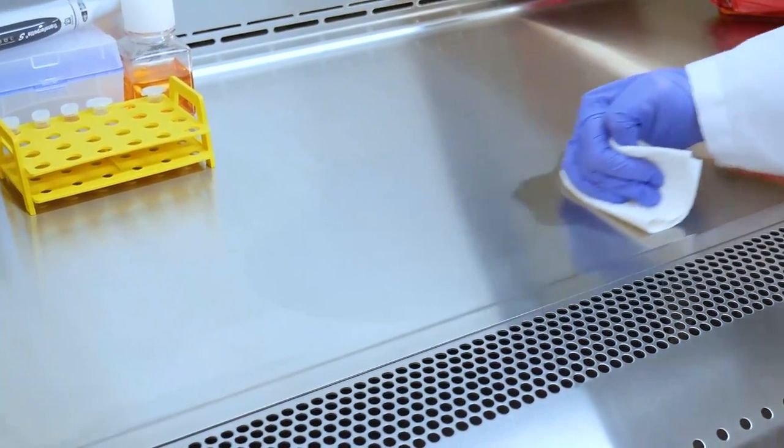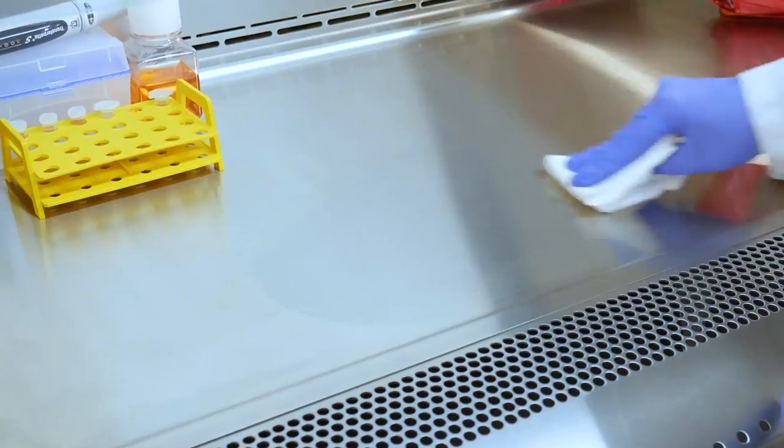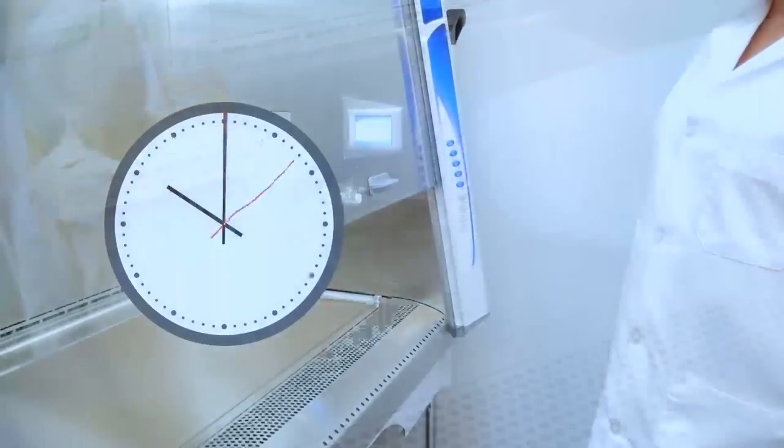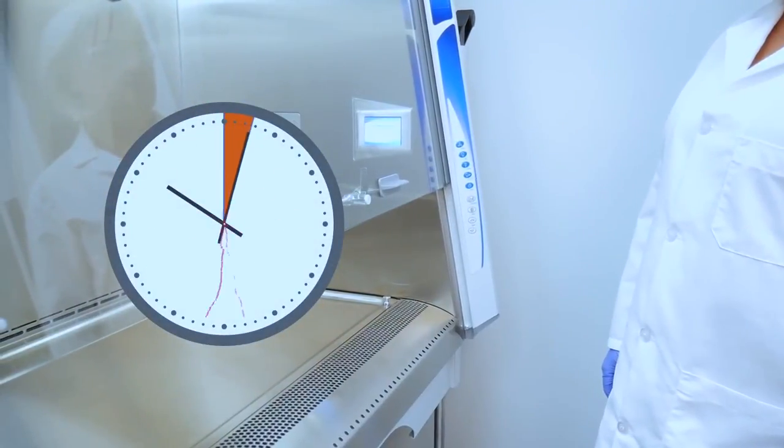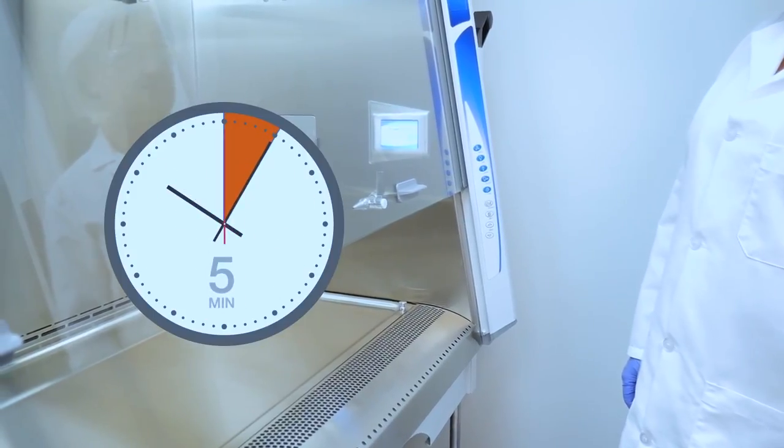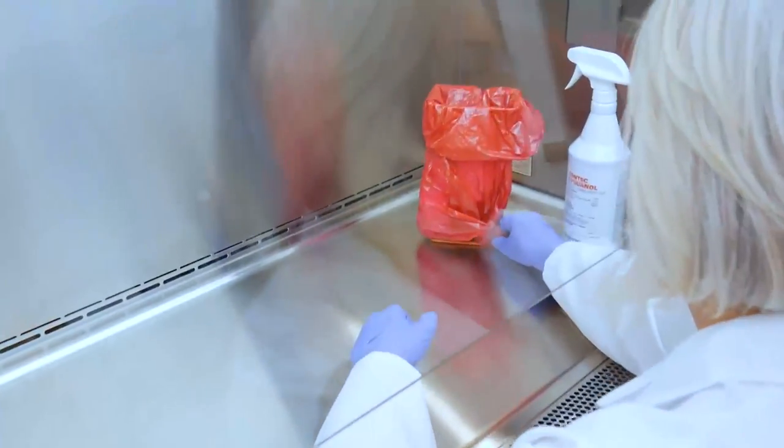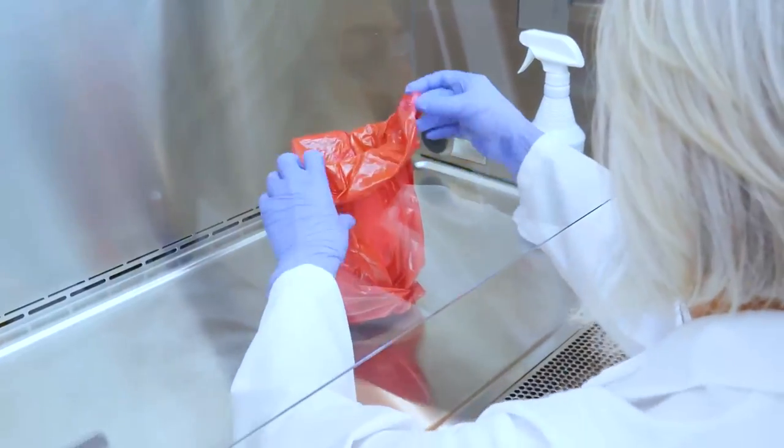After cleanup, wipe the area again along with any other impacted areas. Let the cabinet run for five minutes after any major spill to ensure that all aerosols are filtered out of the cabinet. Then safely dispose of any biohazardous wastes.